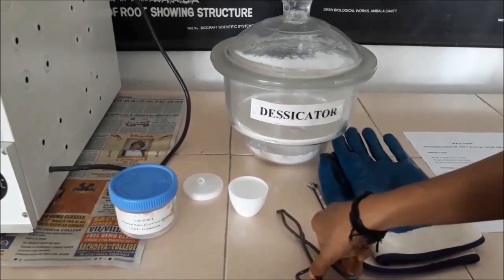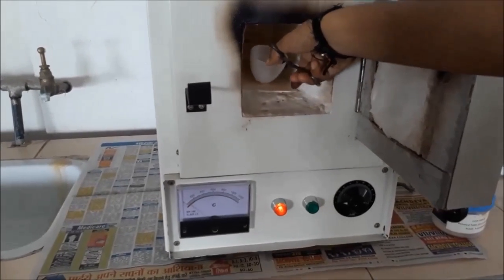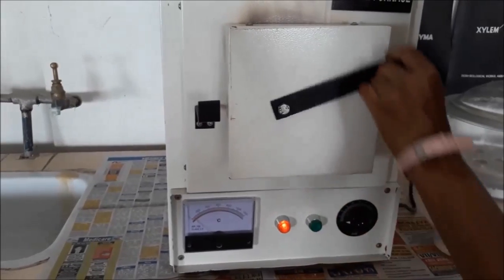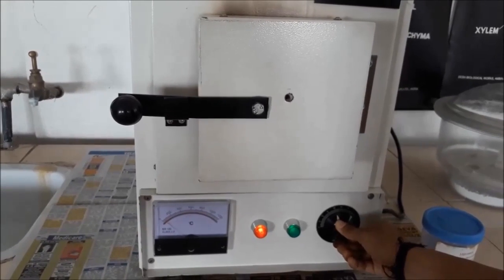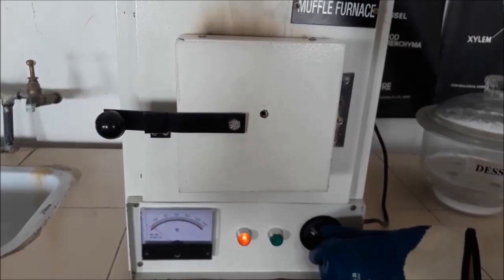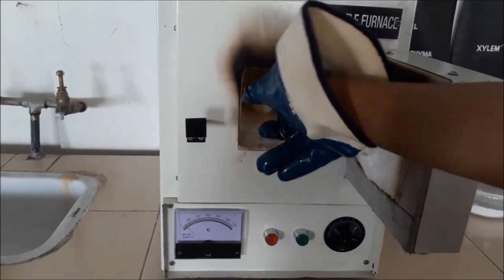Take an empty silica crucible and place it into the muffle furnace with the help of the tongs for ignition. Carefully close the door of the muffle furnace and set the temperature to 600 degrees Celsius. Ignite the silica crucible for about 30 minutes. After 30 minutes, switch off the muffle furnace and leave it for a few minutes.